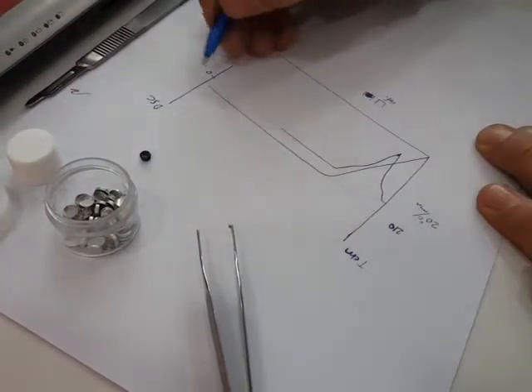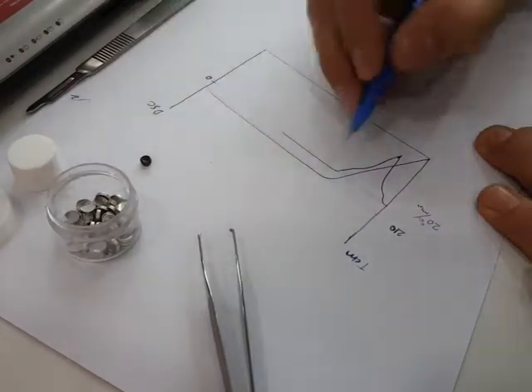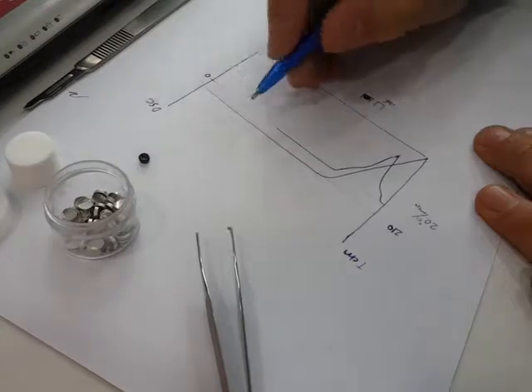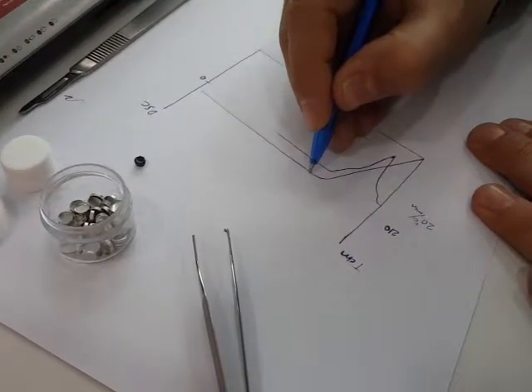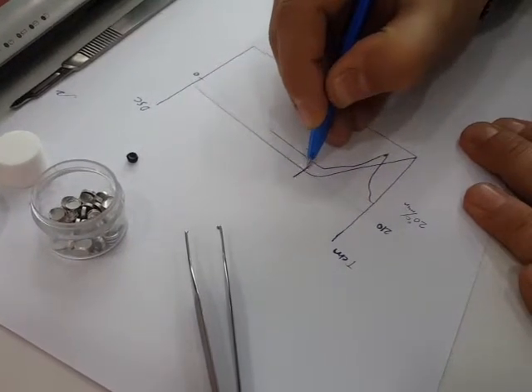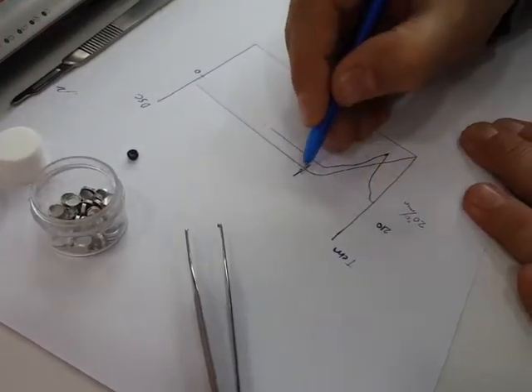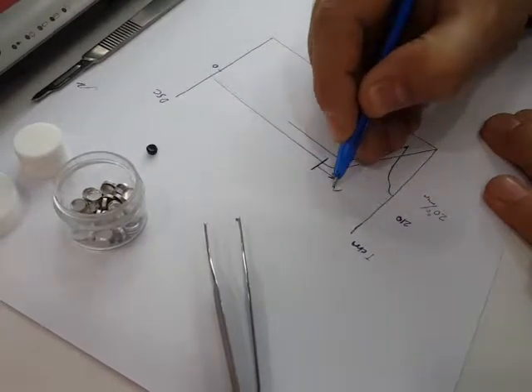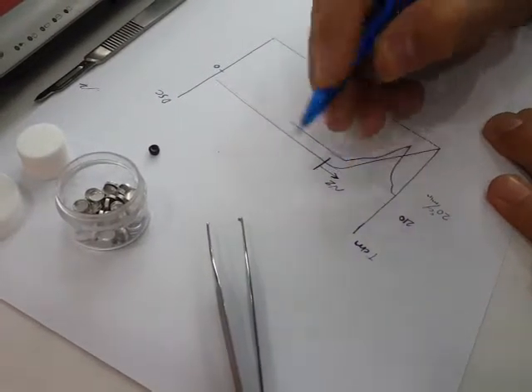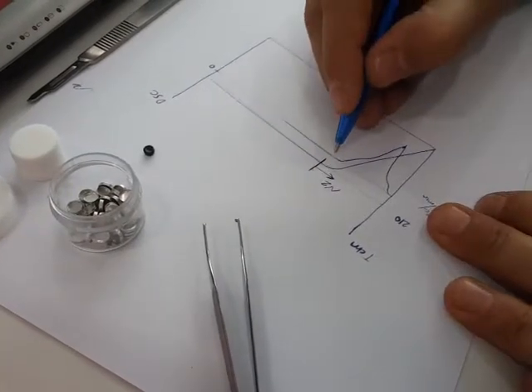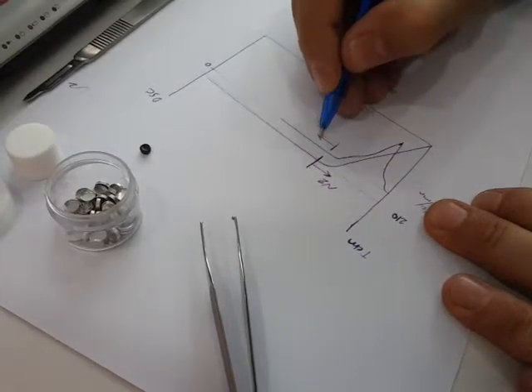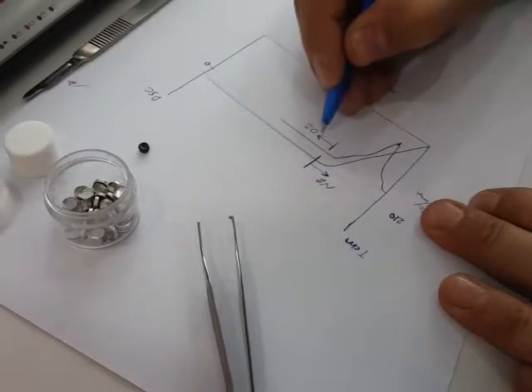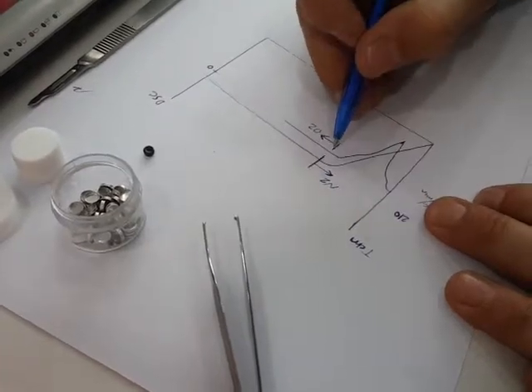After the temperature is stabilized here, before that temperature we have N2 flow in the chamber. After the temperature is stabilized, nitrogen will be closed and oxygen will be opened. The oxidation of the material in that temperature will be started.